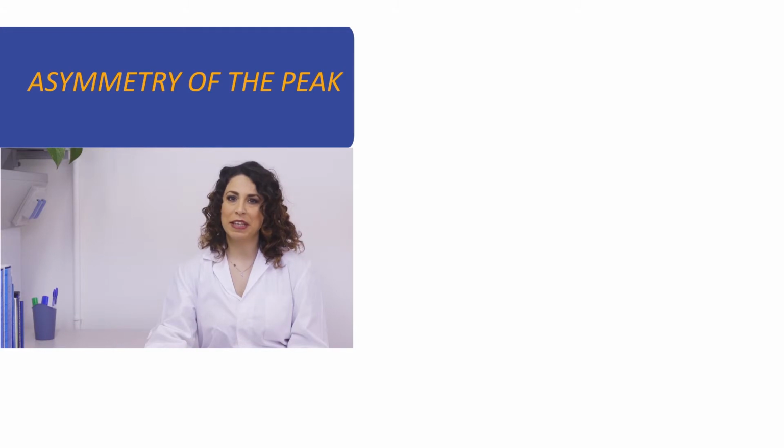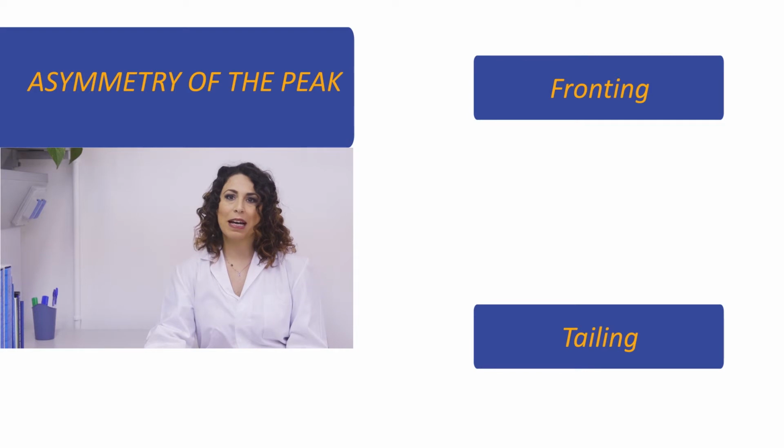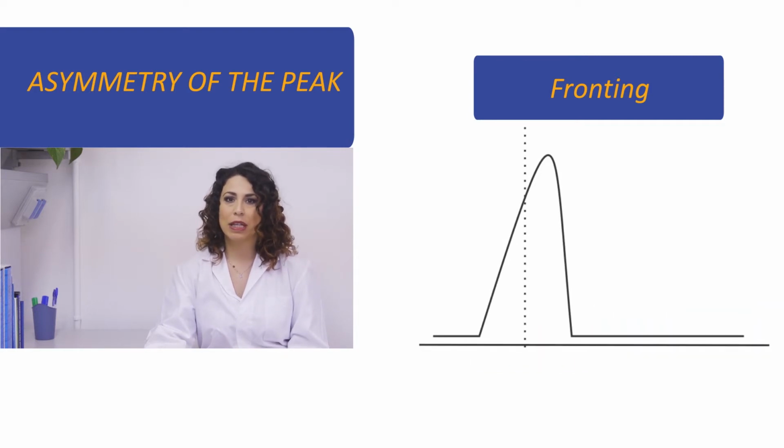Other problems can be identified from reading the chromatogram. Such problems involve the system or the column. Here are some examples. Usually, chromatograms appear in the symmetric shape of a Gaussian curve. It can happen, however, that peaks are deformed. There are two kinds of asymmetries, called fronting and tailing. We can talk about fronting when the front part of the peak is less steep than the following side. Or better, the slope of the front part is smaller than the following side.